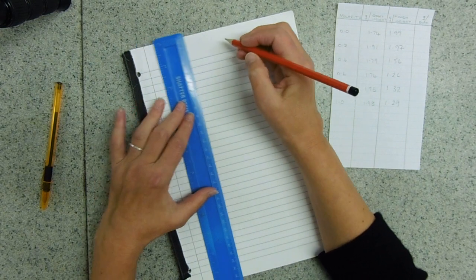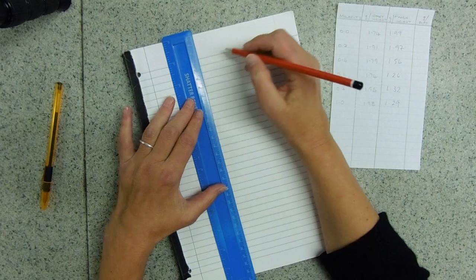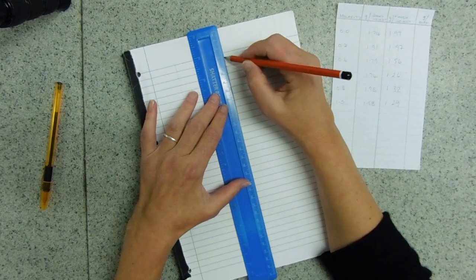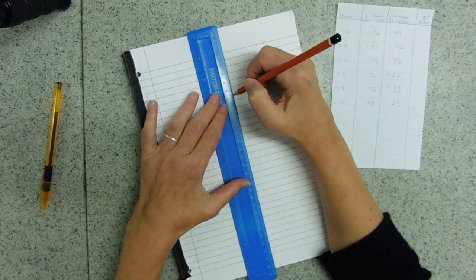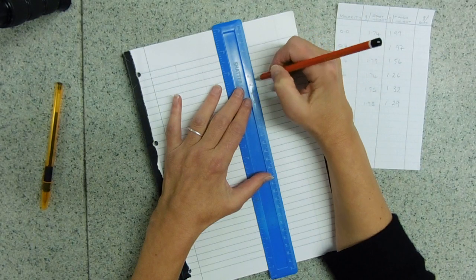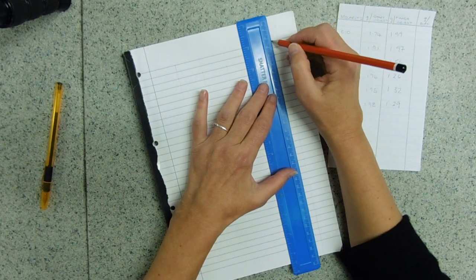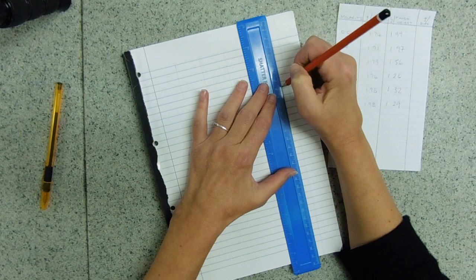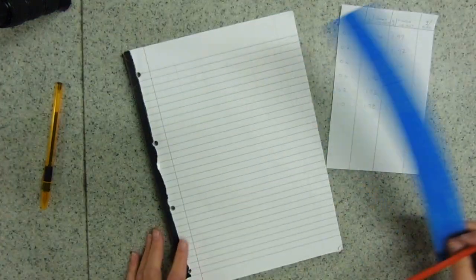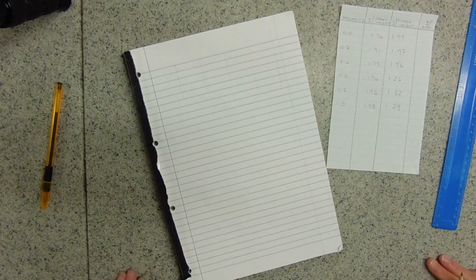Sorry to be a bit OCD and retentive about this, but I need to know how much room my title is going to take. I've removed the paper which was carefully positioned by Dr. Samuel. Oh no, we're OK — we're good at an angle. It means I can actually write.